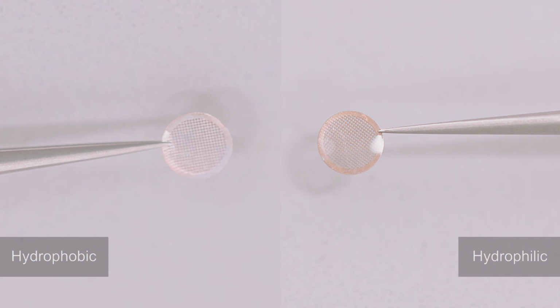This is the reason why we have to glow discharge the grid before we use it, to make it hydrophilic, so that we can create a uniform layer of water solution with our proteins inside.